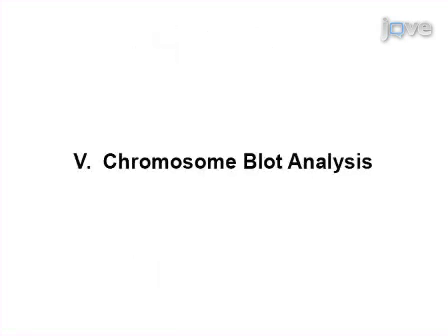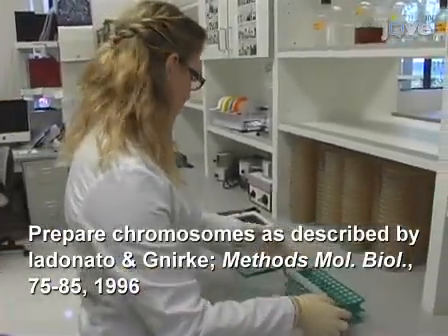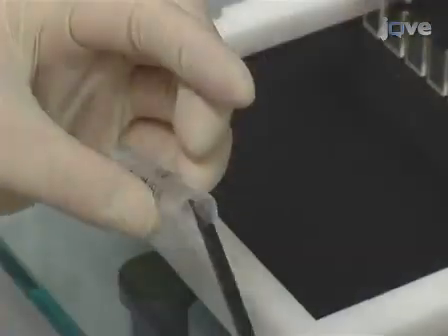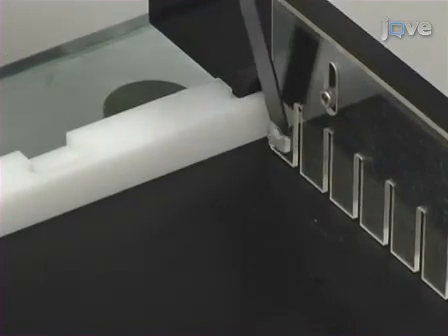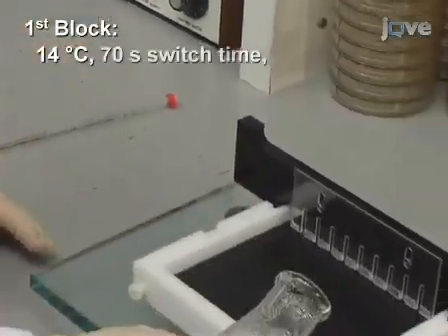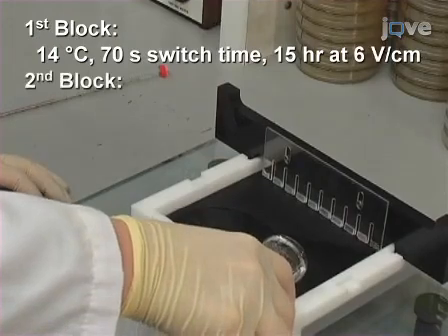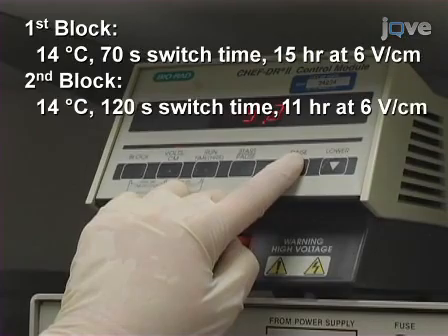Another way to examine putative translocation-bearing clones is by chromosome blot analysis. Chromosomes are first prepared from selected His plus recombinants in agarose plugs. Separate chromosomes on a 1% agarose gel in a contour-clamped homogeneous electric field, or CHEF, at 14 degrees Celsius. The following parameters are used. First block, 14 degrees Celsius, 70-second switch time, and 15 hours at 6 volts per centimeter. Second block, 14 degrees Celsius, 120-second switch time, and 11 hours at 6 volts per centimeter.